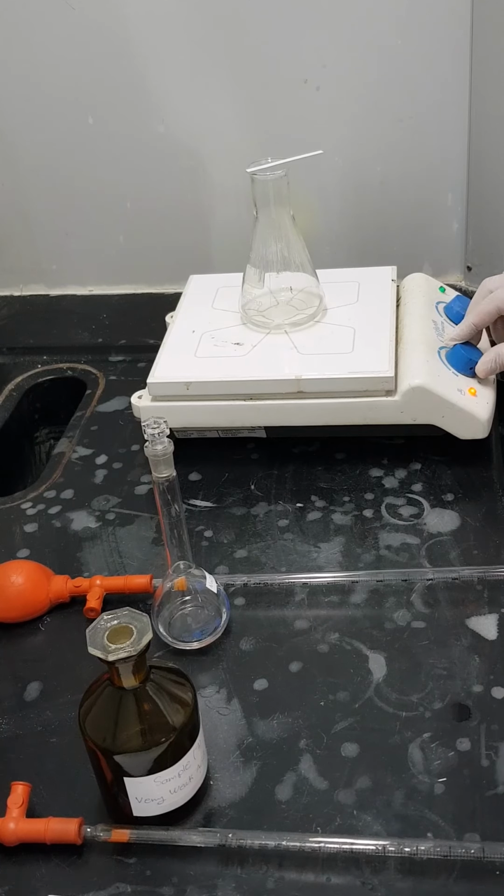I'm adjusting the temperature to be around 70 degrees, so I think it will take a few minutes. Now, if you can notice, there's a small amount of fumes coming outside, and I'm sure that the fume cupboard is protecting us from smelling such harmful gases. However, you can still smell very low concentrations of ammonia, which is a very common odor, and you can easily recognize it.